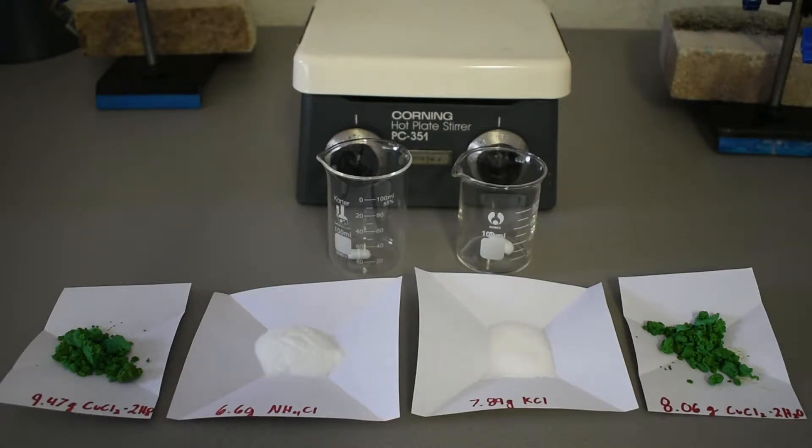Hello everyone, welcome to another video. Today we're going to make two compounds actually, two compounds in one video.